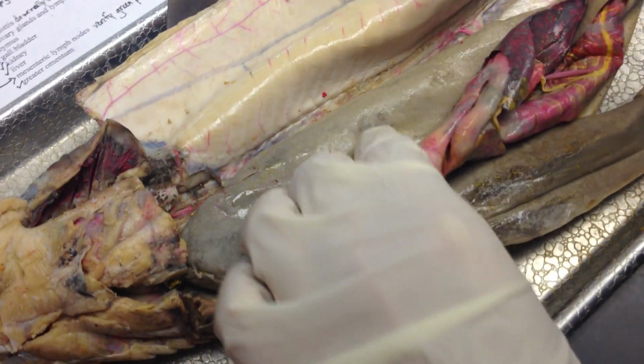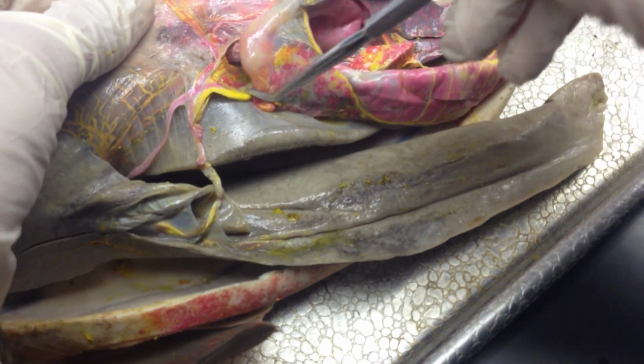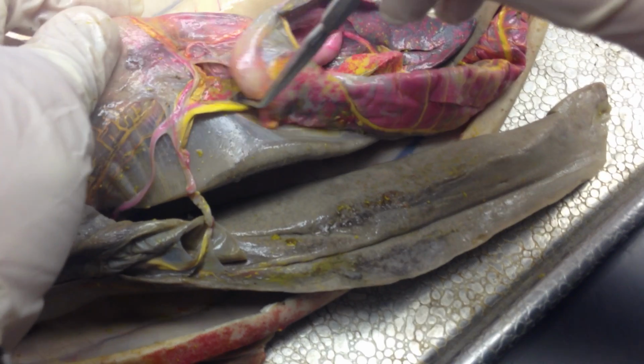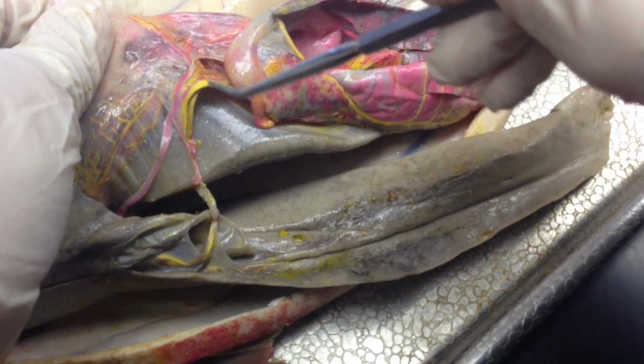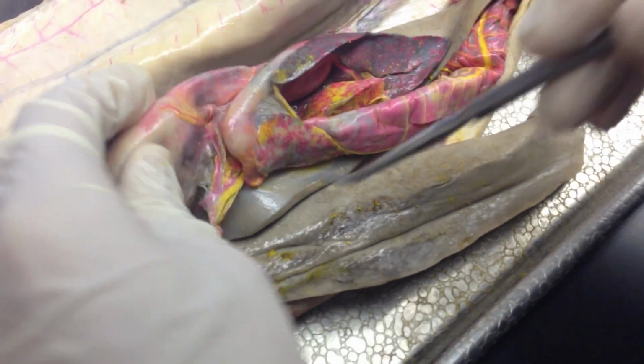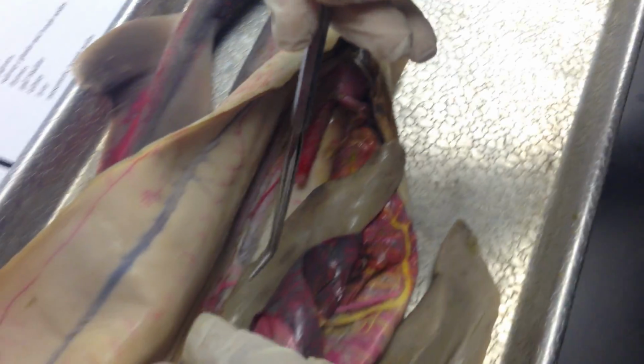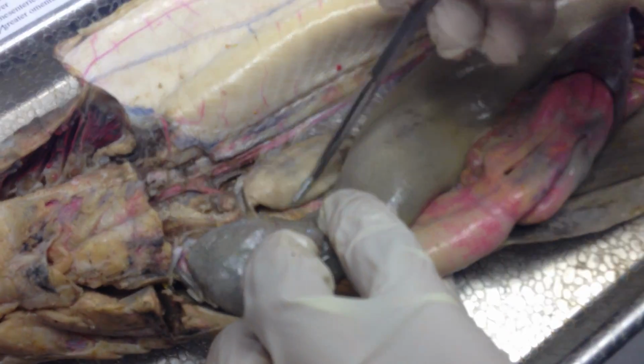The pancreomesenteric artery and vein, so going back after the celiac to where this splits, the pancreomesenteric is this one. This is the vein. And the artery is there as well. The digitiform gland is this. It's two. The gonads, in this case a male with the testes right here.